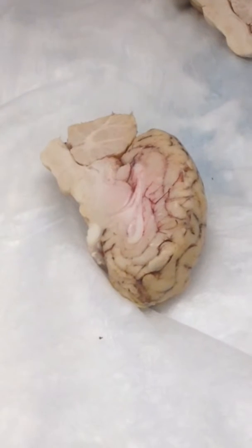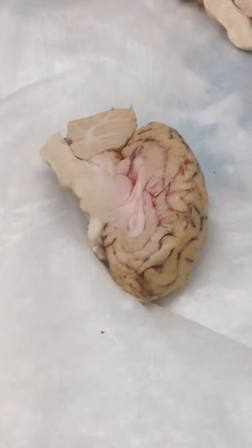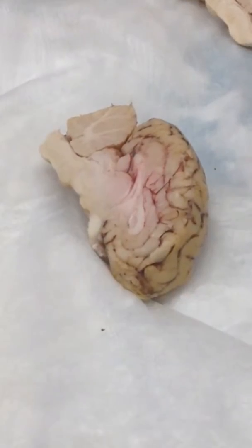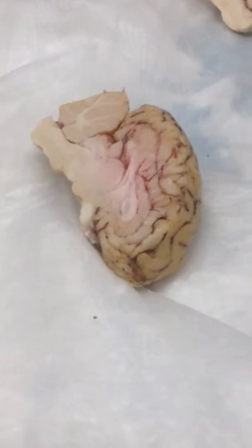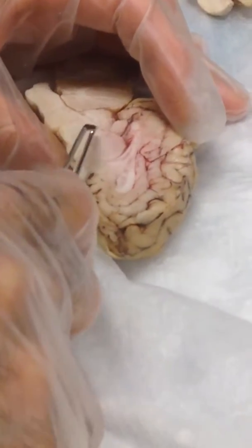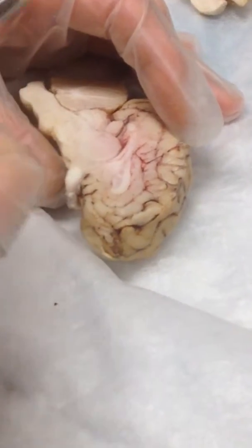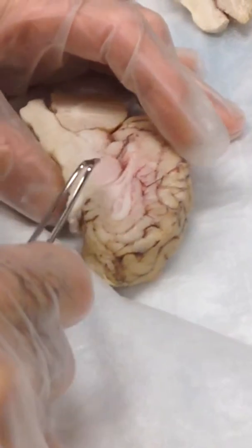The third ventricle is really, really shallow. And so when you cut down midline, because the aqueduct tells you that, right? You're not going to see a big pocket. You're just going to see a little indentation, which in this case means it's shiny because it's not cut. I see how thin it is. Right, so it's a small hollow.